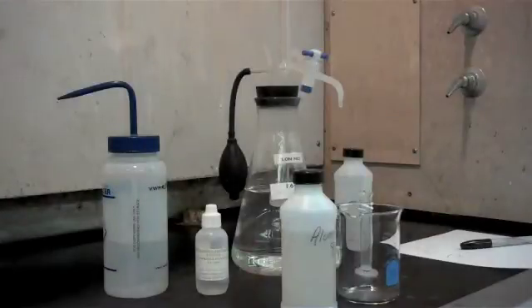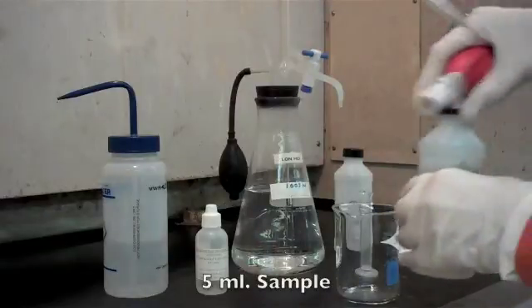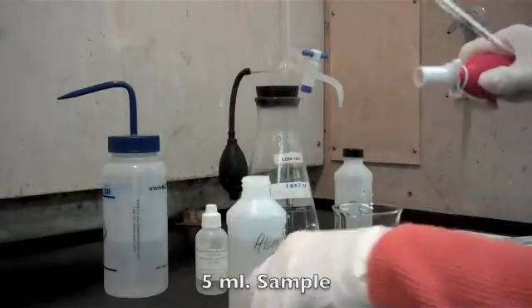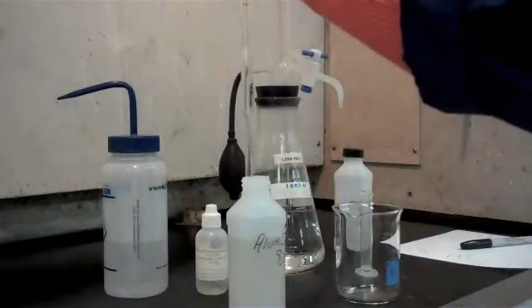This is a demonstration for the titration of concentration and aluminum content in an aluminum etch bath. The first thing we're going to do is take a 5 mil sample of our aluminum etch bath and put it into a clean beaker.